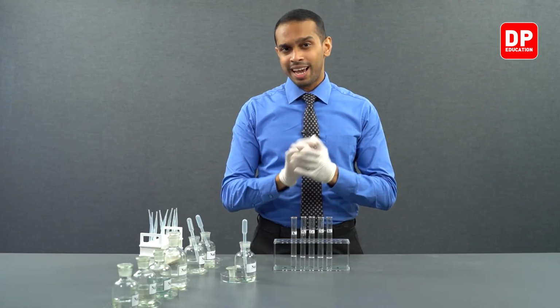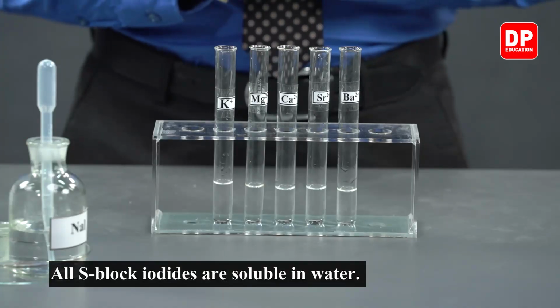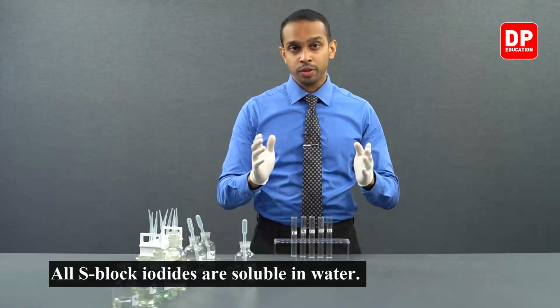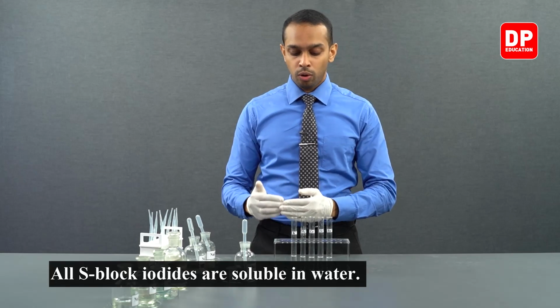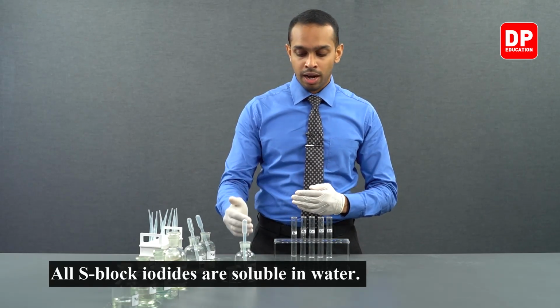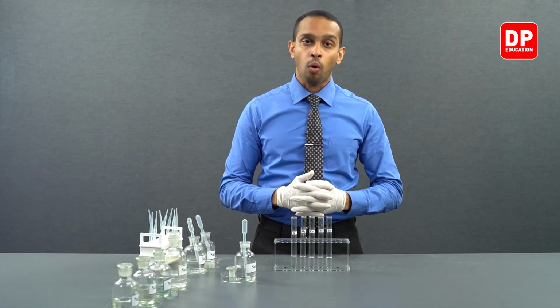So students, as expected, all of the iodide ions, when reacted with these cations we have in front of us, did not form a precipitate, indicating all of these iodide salts that are formed when iodide ions are reacted with these cations are water soluble.